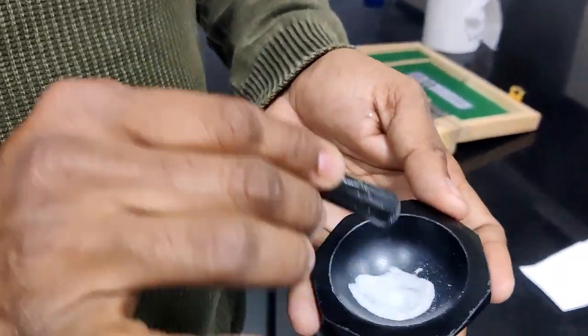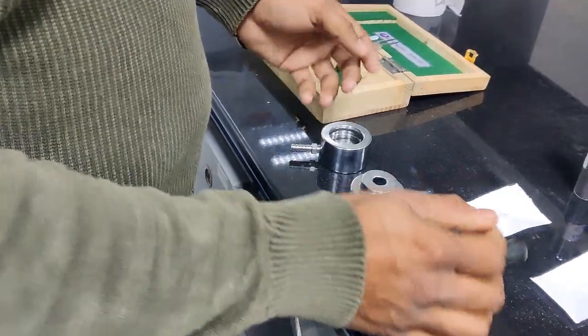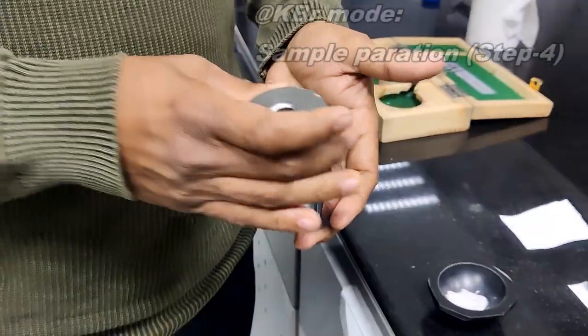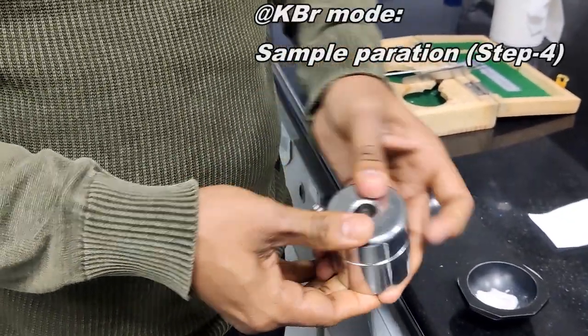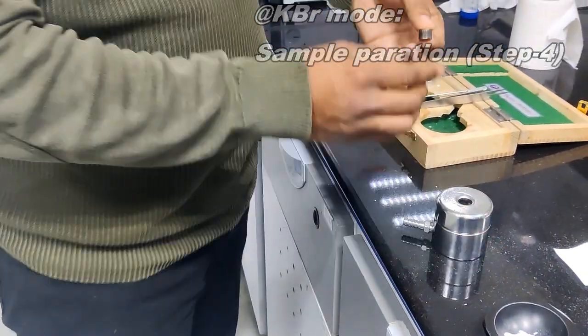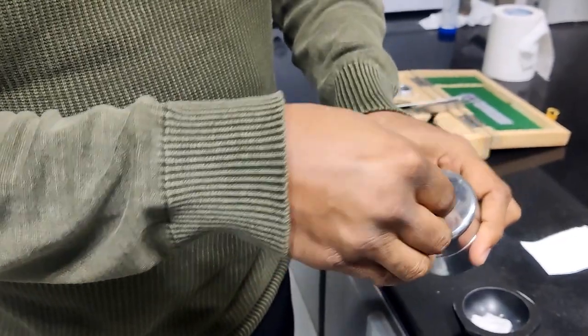After grinding and preparing the fine powder, we have to prepare the sample pellet. For that, we have to take the die. This is a base, and I am keeping the upper part like this, pressing lightly. After fixing this, I am taking the lower plunger. I am just keeping this side inside the die.